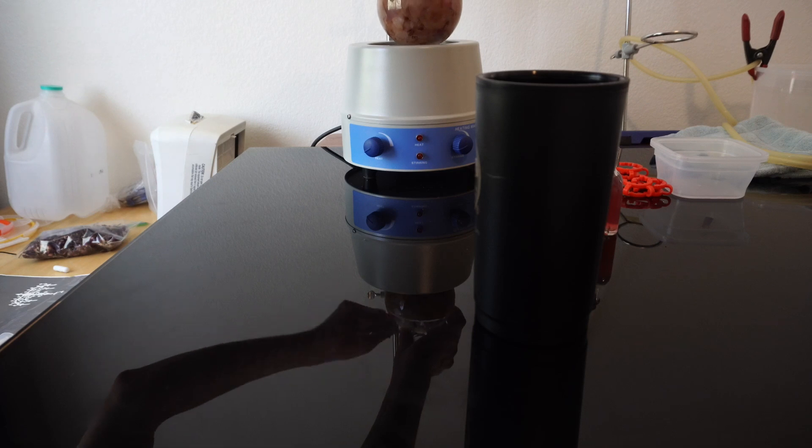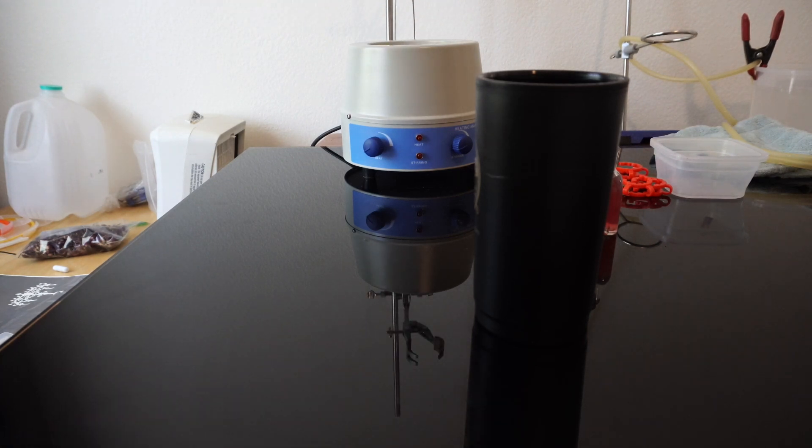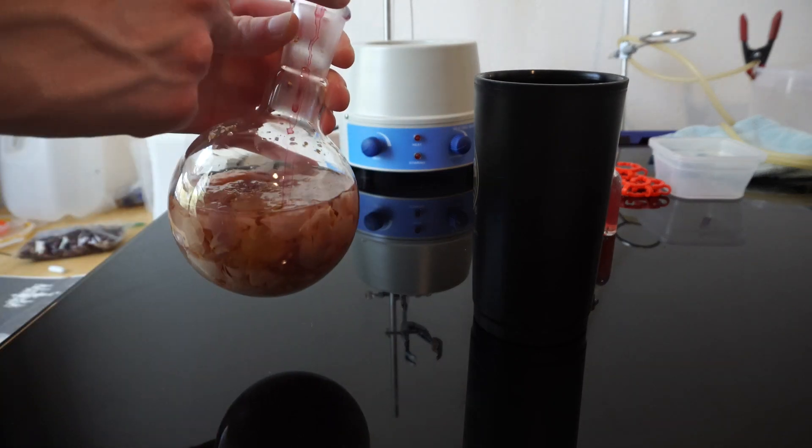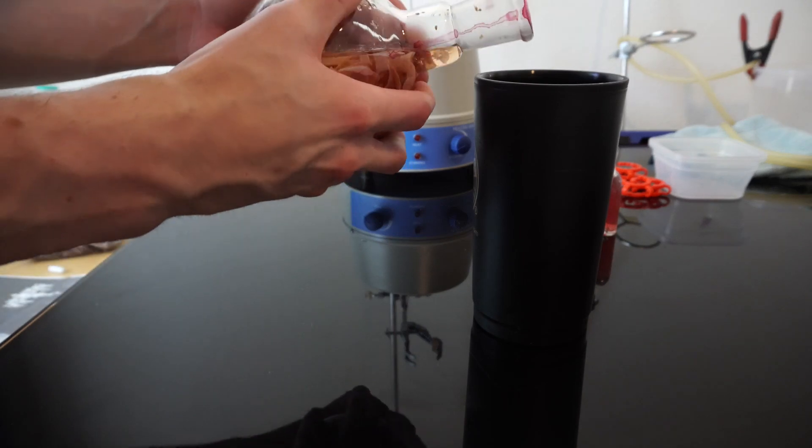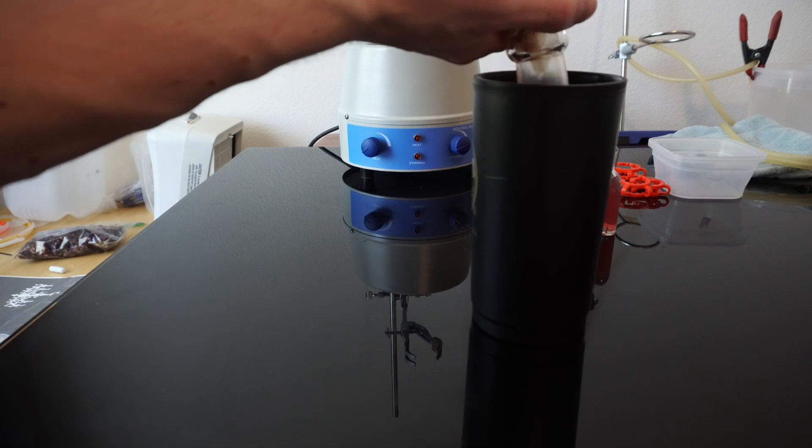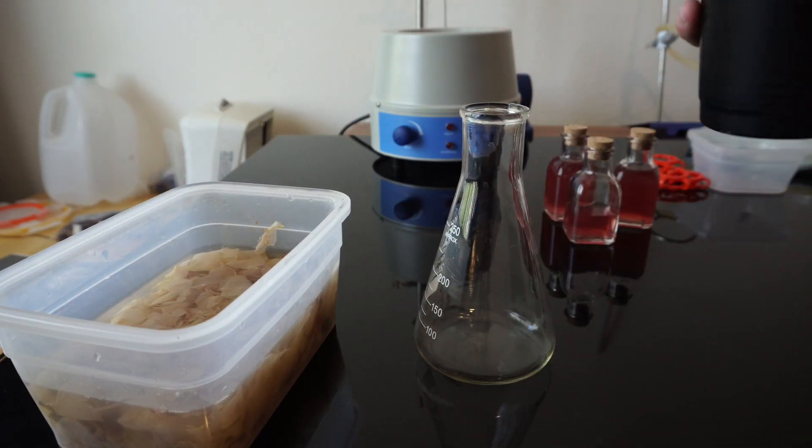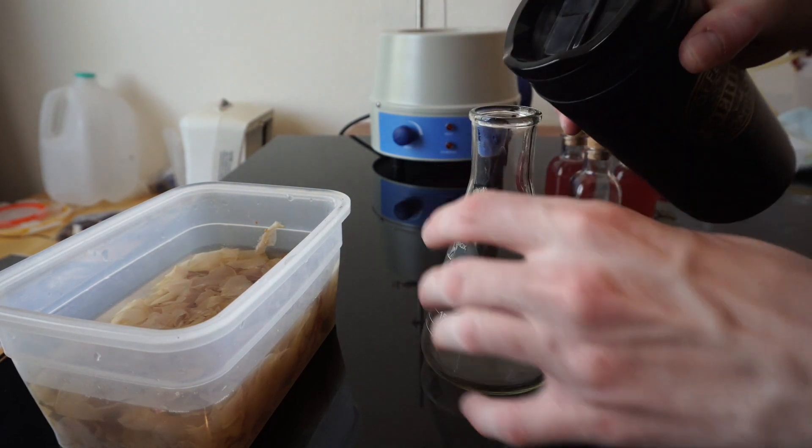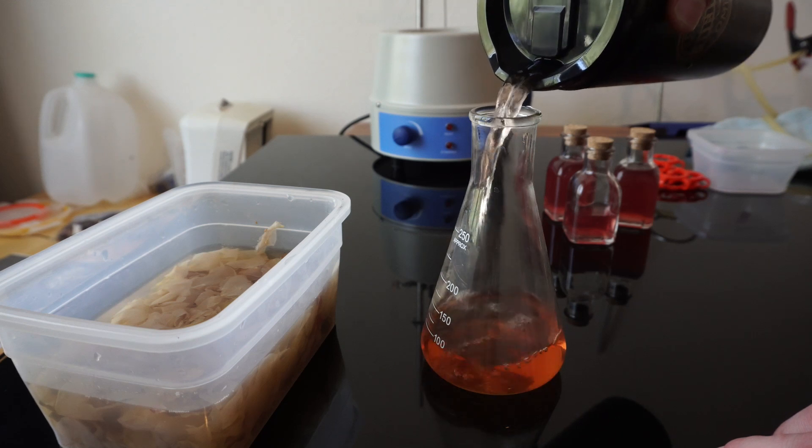Then we will follow the same steps for the remaining oil, water, and plant material that was in our boiling flask at the beginning. We can see how murky and cloudy everything currently looks, however, filtering it gave it a nice blood red color with some deeper floral smells. You can see the petals in the container to the left and then the rest of the oil and water I will dump into the flask, followed by sealing it and coming back tomorrow.